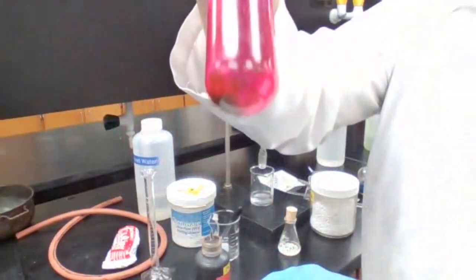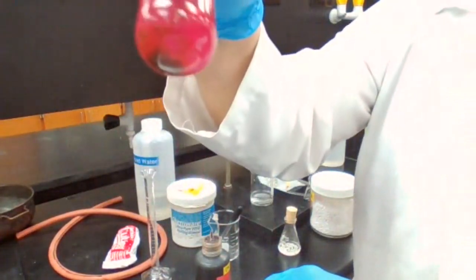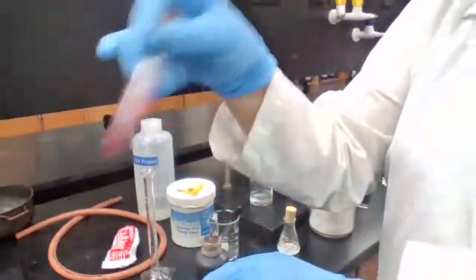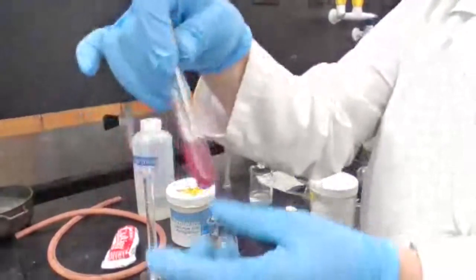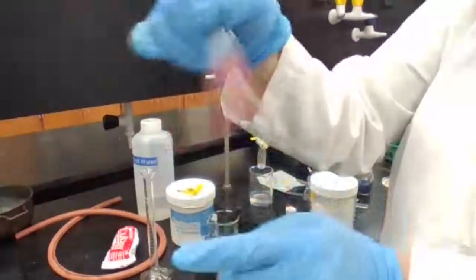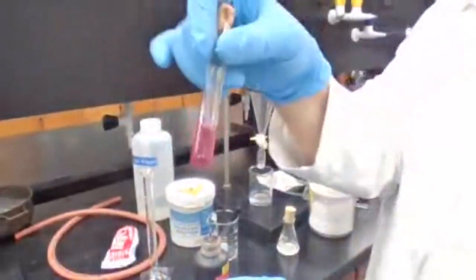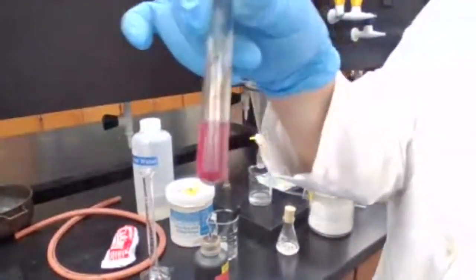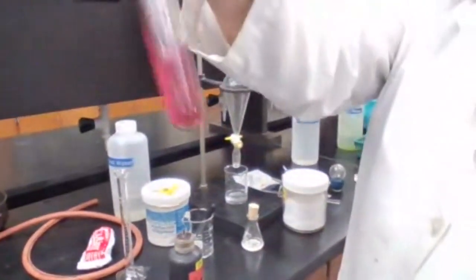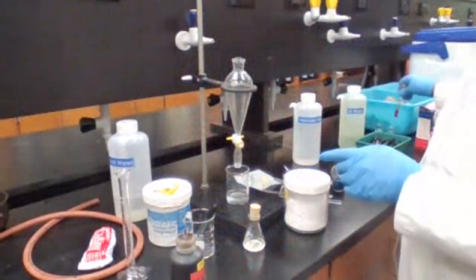At the bottom of the test tube, do you see the brown precipitate? Yes? Okay. That brown precipitate means that you have a CC double bond. So that's a positive test for the Bayer's test, or positive test for a CC double bond. If I wait long enough, the purple color would disappear. I'm not discarding this, but I'm just going to continue with the other part of the experiment and come back to this and show you again. Then you could take a screenshot of it.